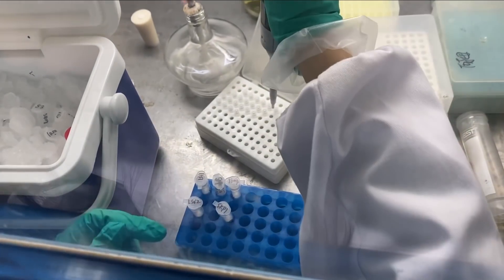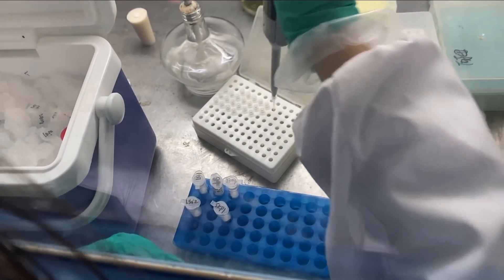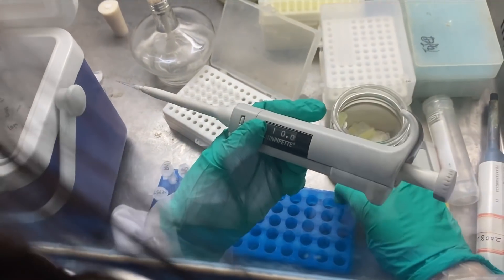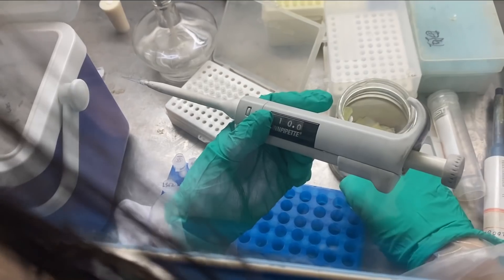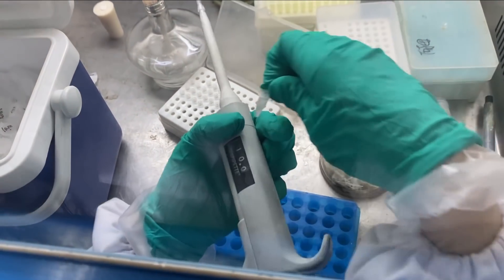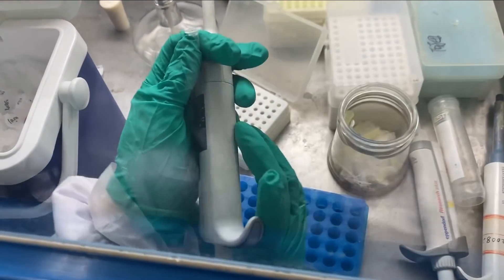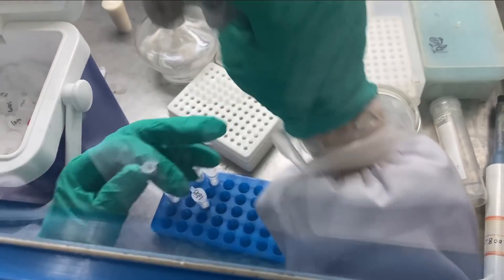After the preparation of carrier DNA, you need to go to the sterile room and transfer all the ingredients to Y2H gold buffer.